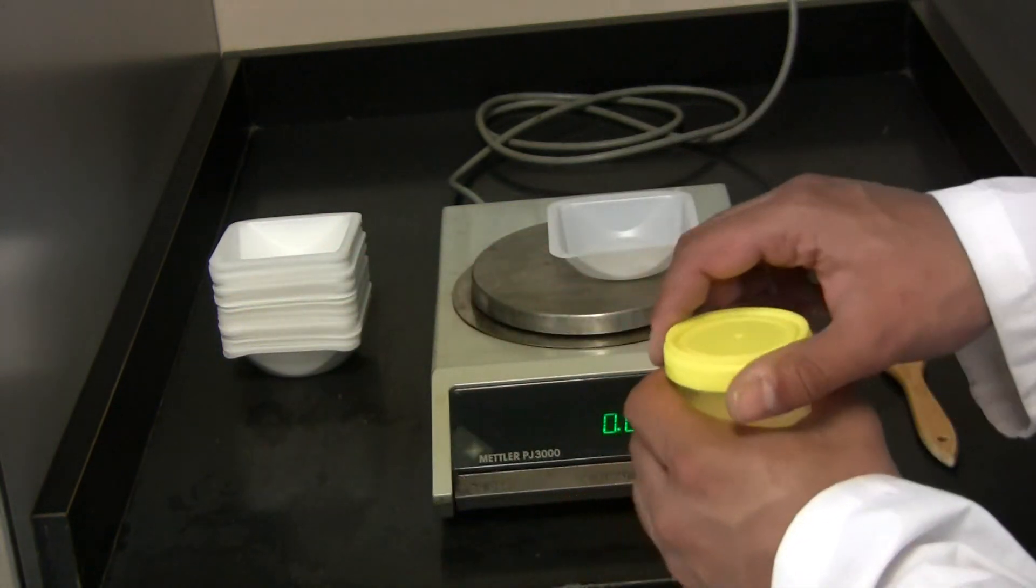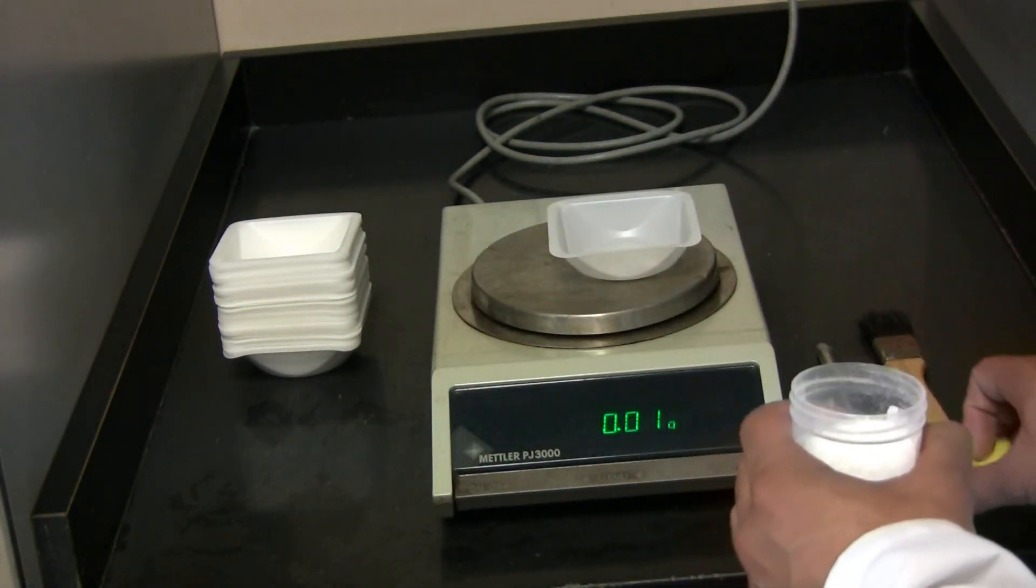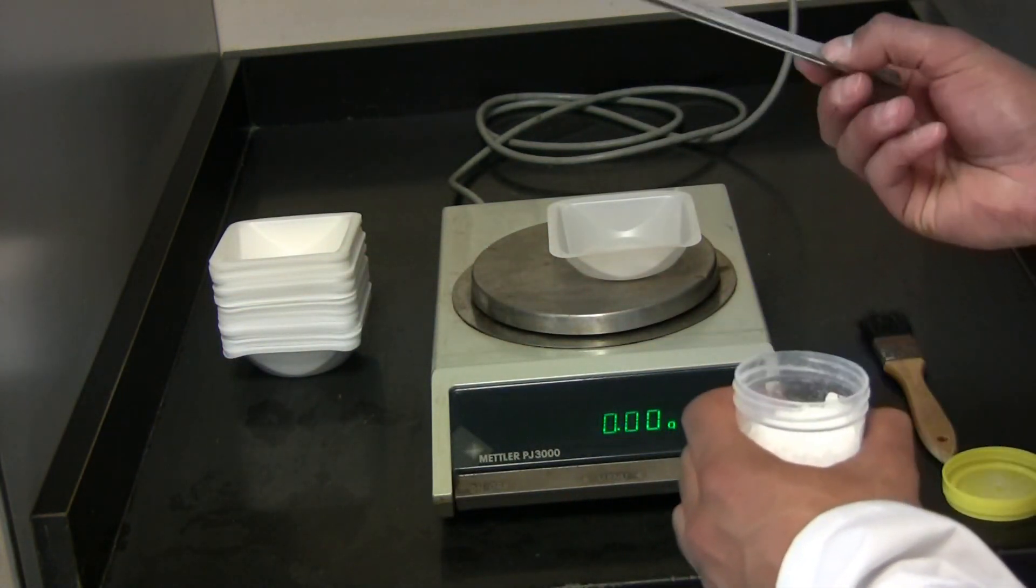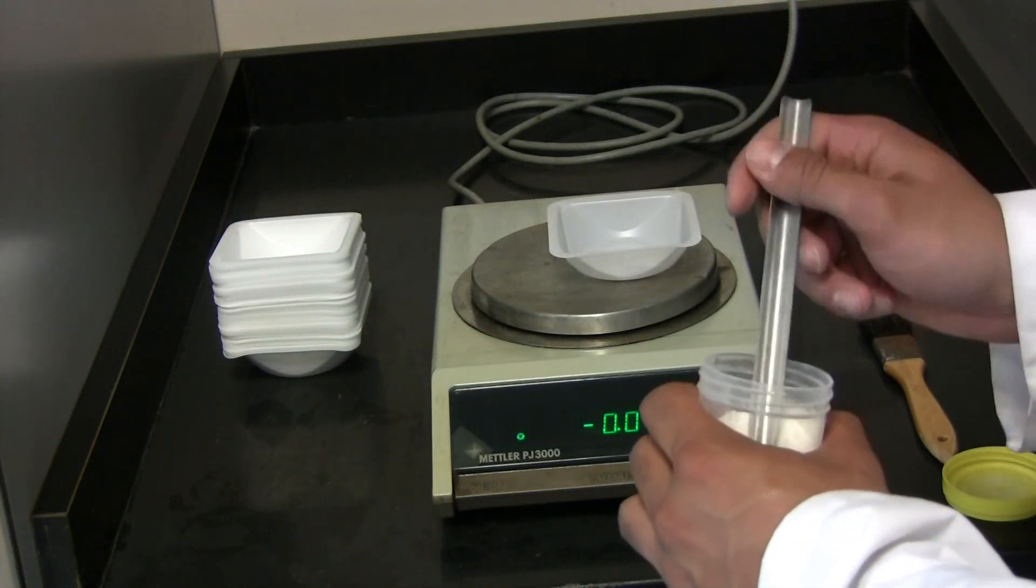Now add your sample to the required amount, in this case one gram.